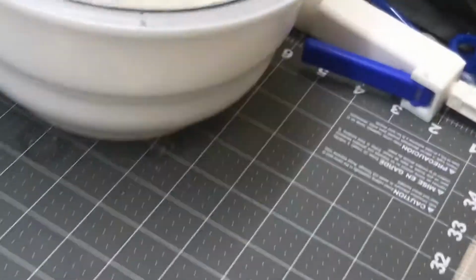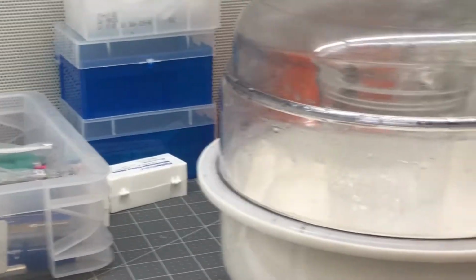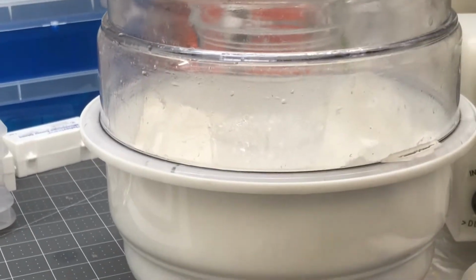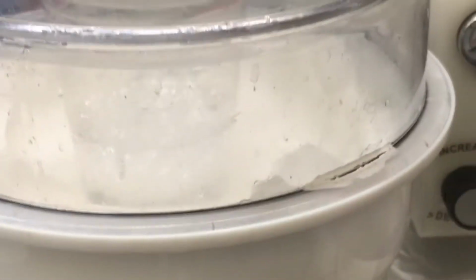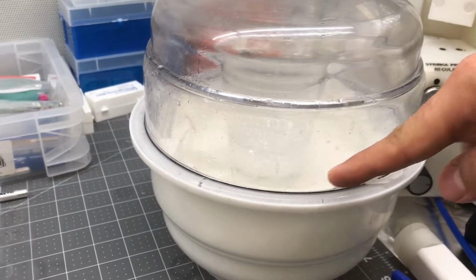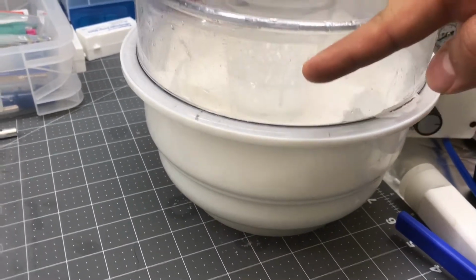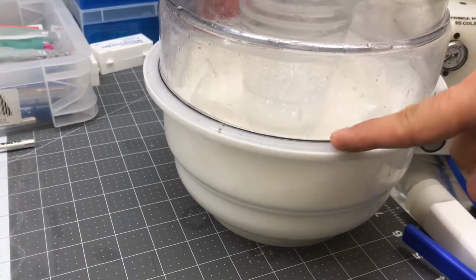And like I said, if you see from this side, you can see two layers. One part is a transparent liquid down here, and another part is the foam, which has bubbles. All of them should be like this.